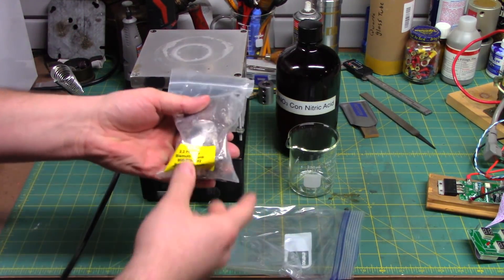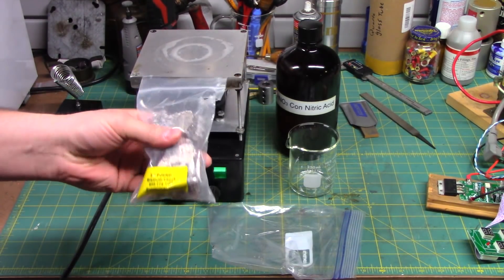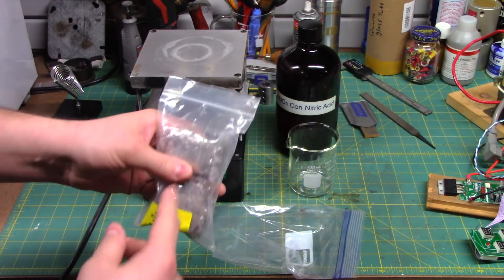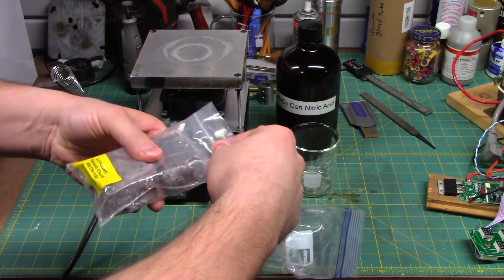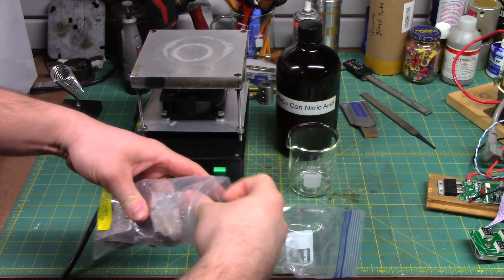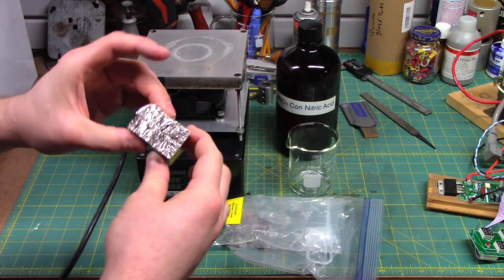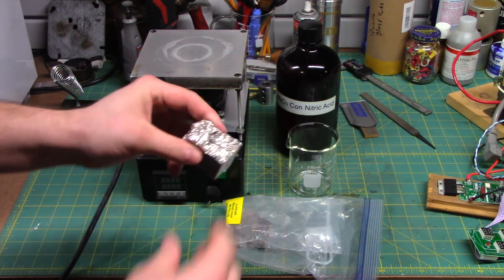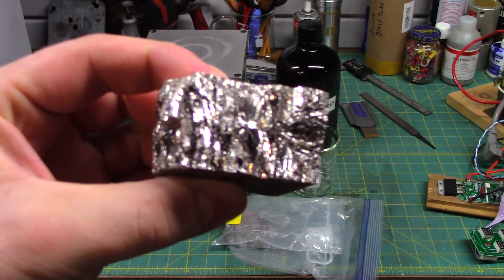What we're doing here is making some bismuth trioxide and you can see here I have some nice pure elemental bismuth from Roto Metals. Got a kilogram of the stuff that's obviously way more than we're going to be making. But God, what a gorgeous metal, huh?